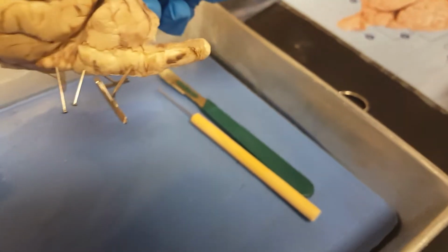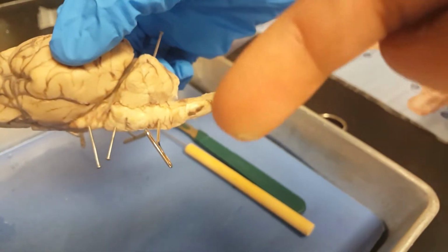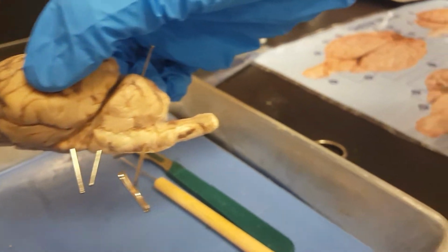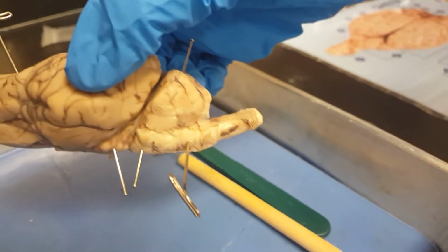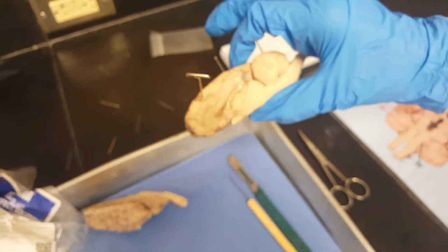This is the medulla, which is right here. That's the part of the vertebrate brain that's continuous posteriorly with the spinal cord and contains the centers that control involuntary vital functions. Now we're moving on to lobes.